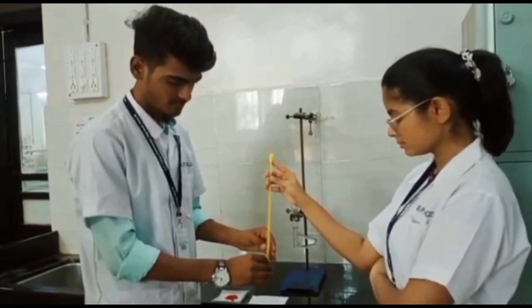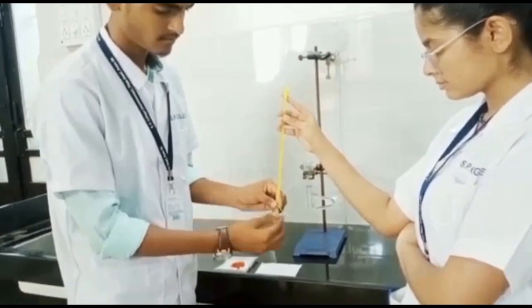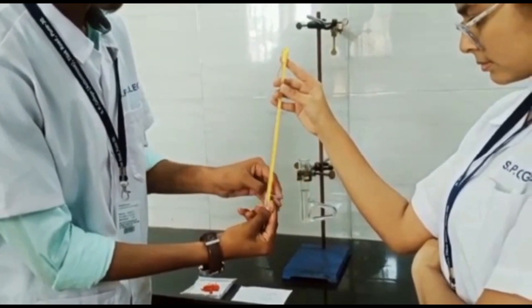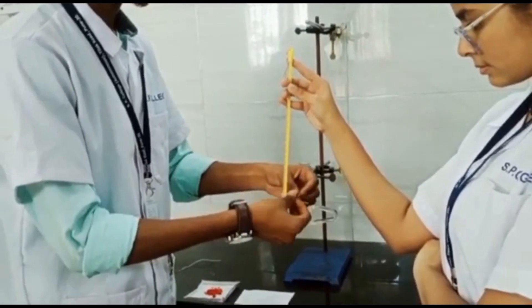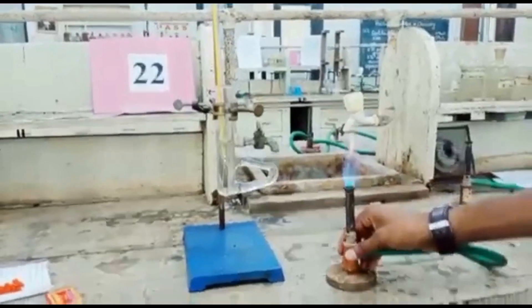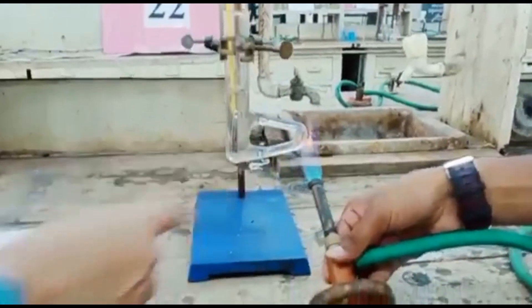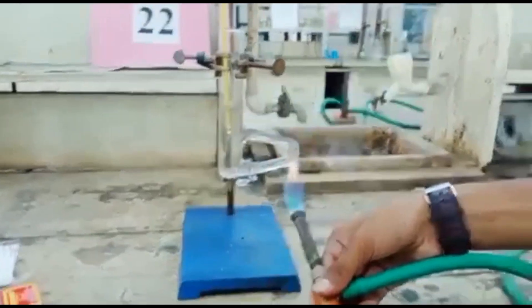Now we will see how the substance is going to be tied to the thermometer. You need to check the position of the substance at the base end with respect to the mercury level, where we can exactly locate the melting point as the temperature of the melted substance relative to the temperature of the mercury. To check for uniform heating, you have to rotate the burner from the base of the Thiele tube to the triangular position so that uniform heating is given to the substance inside the tube.